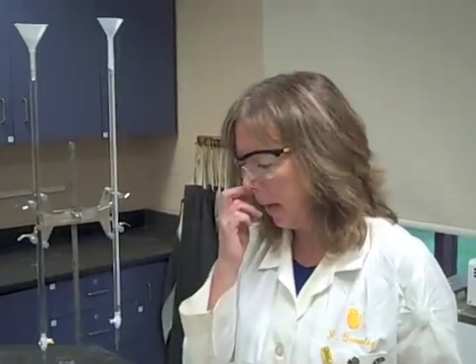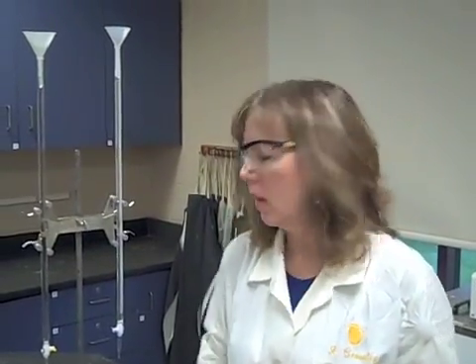This is part two of the acid-base chem lab titration. We are now ready to add the acid. I'm recommending for a good first titration that you add somewhere between five to ten milliliters of your acid that you're going to titrate with your base.